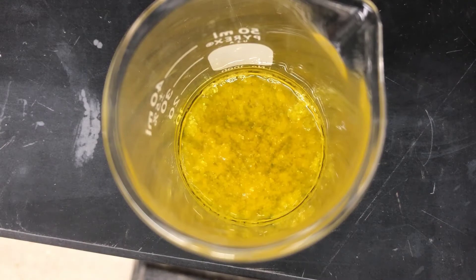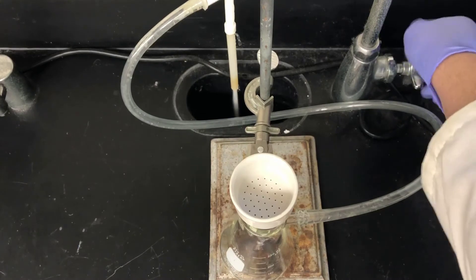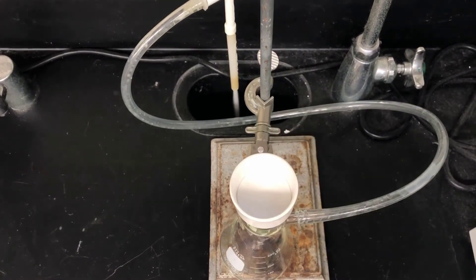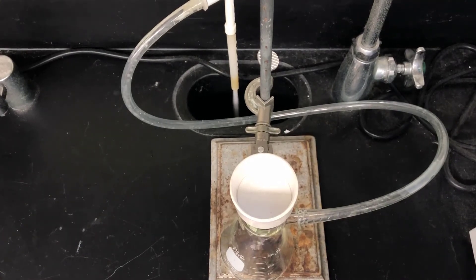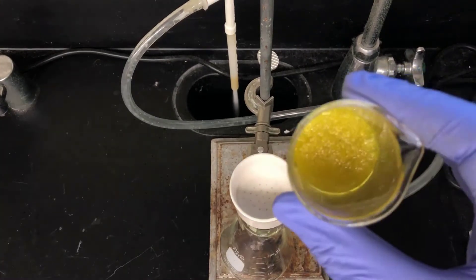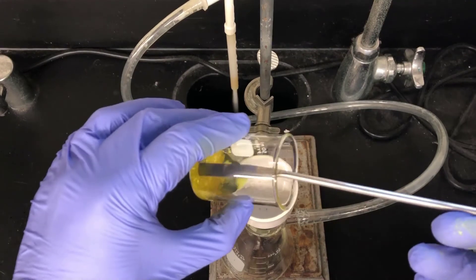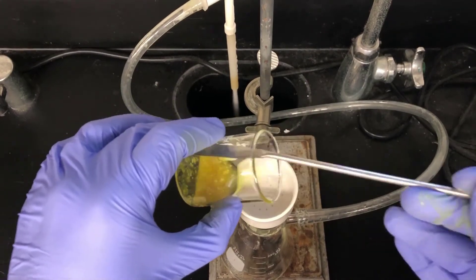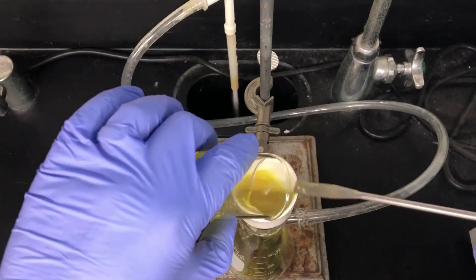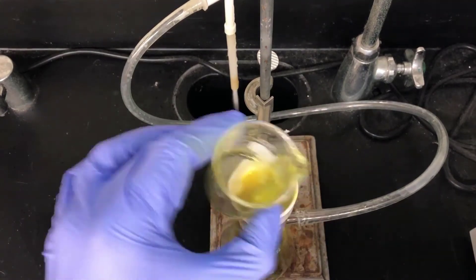Here's what the flask looks like at the end of the process. Now I'll vacuum filter the crystals. I'll turn the water aspirator on and place a piece of filter paper in the Buechner funnel, then wet the paper down with a little isopropyl alcohol to seat it against the holes. Now I'll pour the crystals into the Buechner funnel using a spatula to help transfer them, and then rinse the beaker with a little isopropyl alcohol to transfer the crystals more completely.